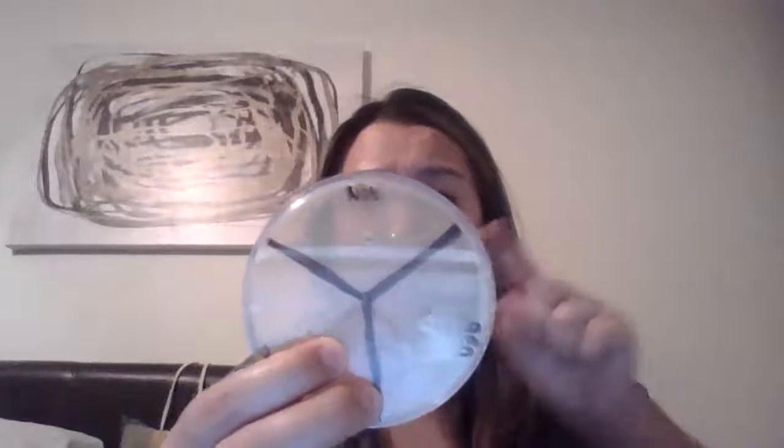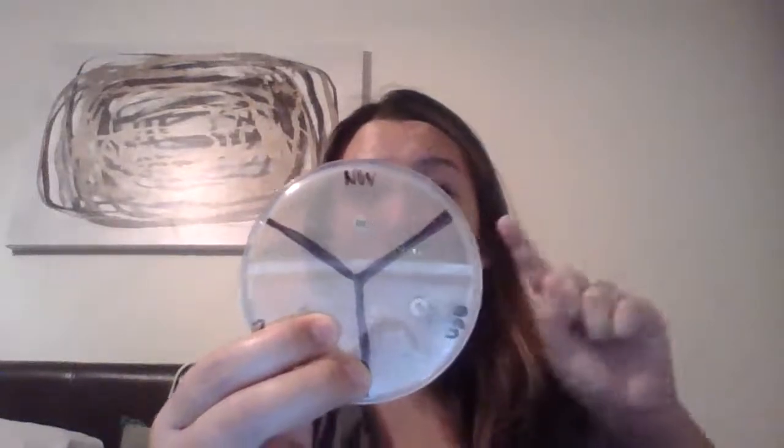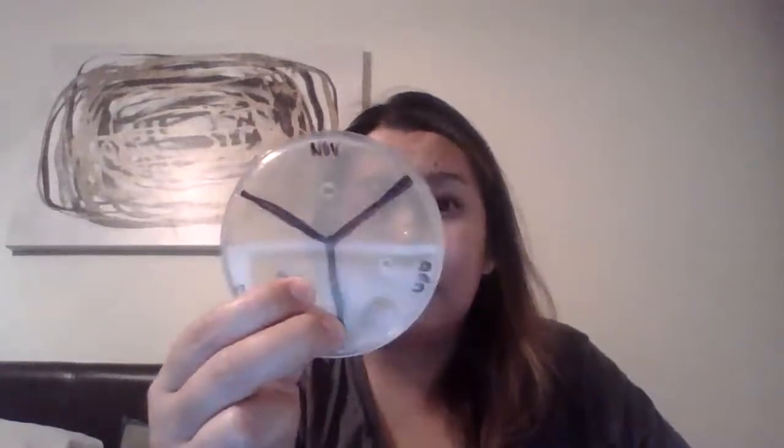With novobiocin, there is actually no circular area at all. So that would be considered resistant, meaning it wouldn't work for that specific bacteria.